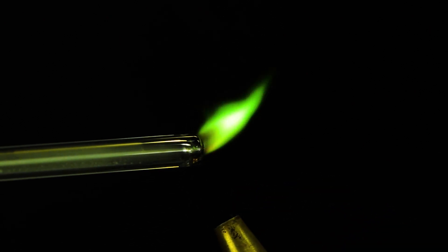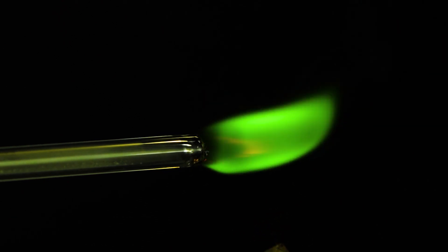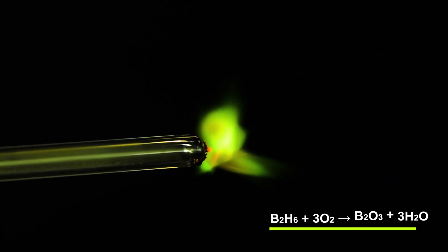Notice how burning diborane in oxygen produces boron oxide. When it burns in air, it's not as distinct because oxygen in the air is also spent on burning the hydrogen that is produced in the reaction.